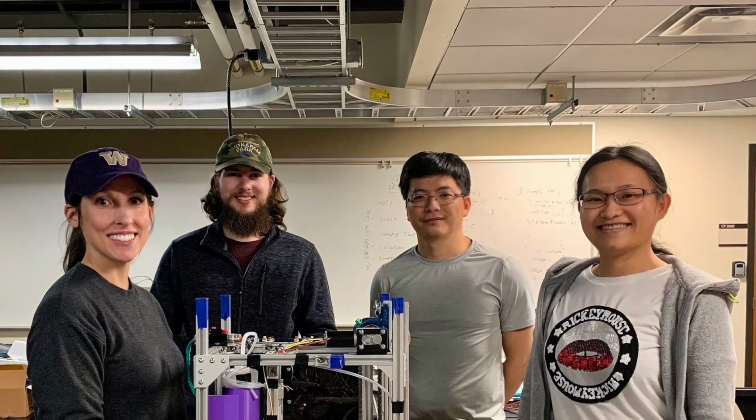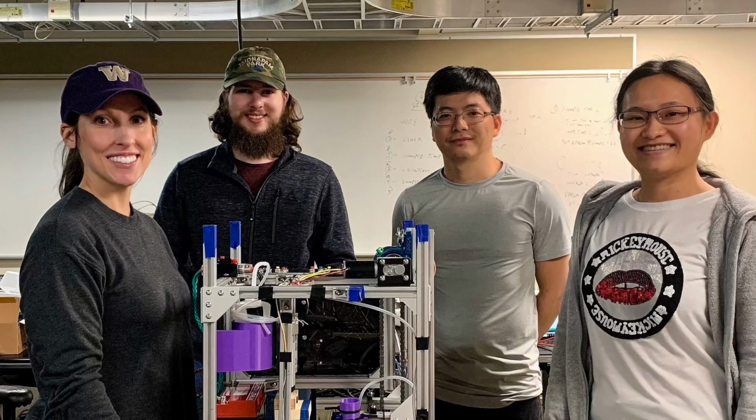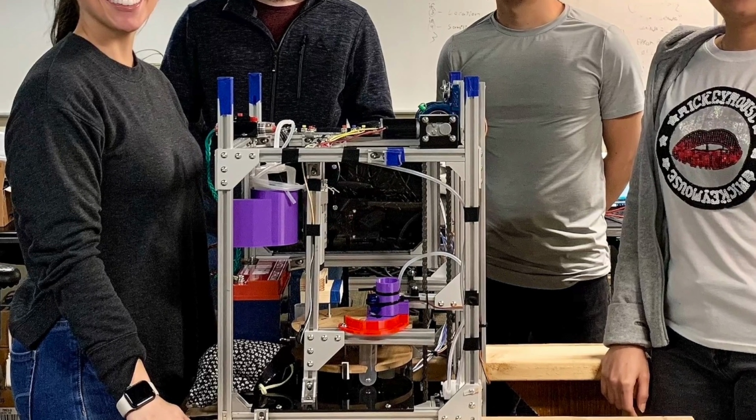The effects of COVID-19 have impacted all of our lives in one way or another. We feel so proud to have successfully developed this prototype device that once further expanded will have such a positive impact on the future of tracking diseases.